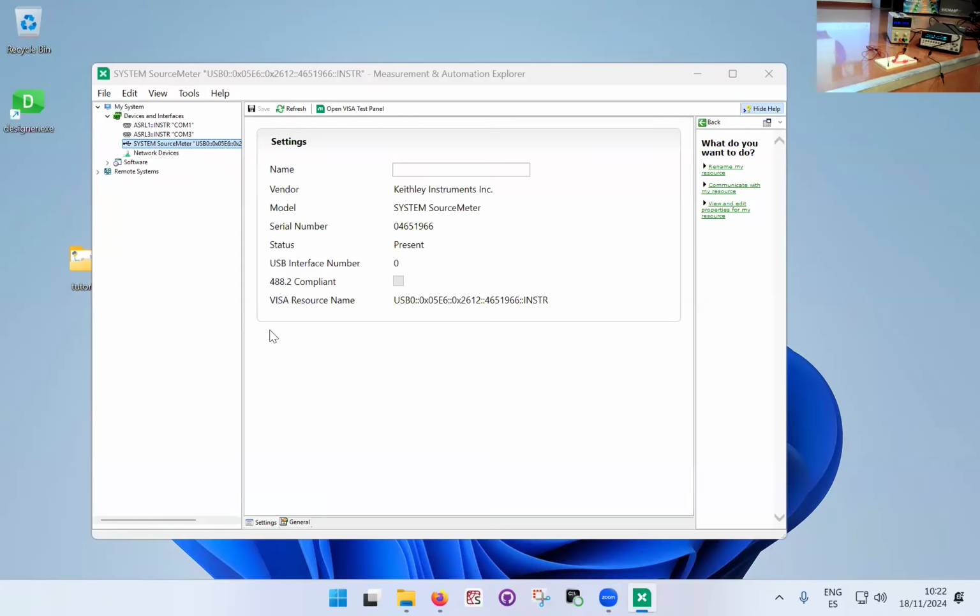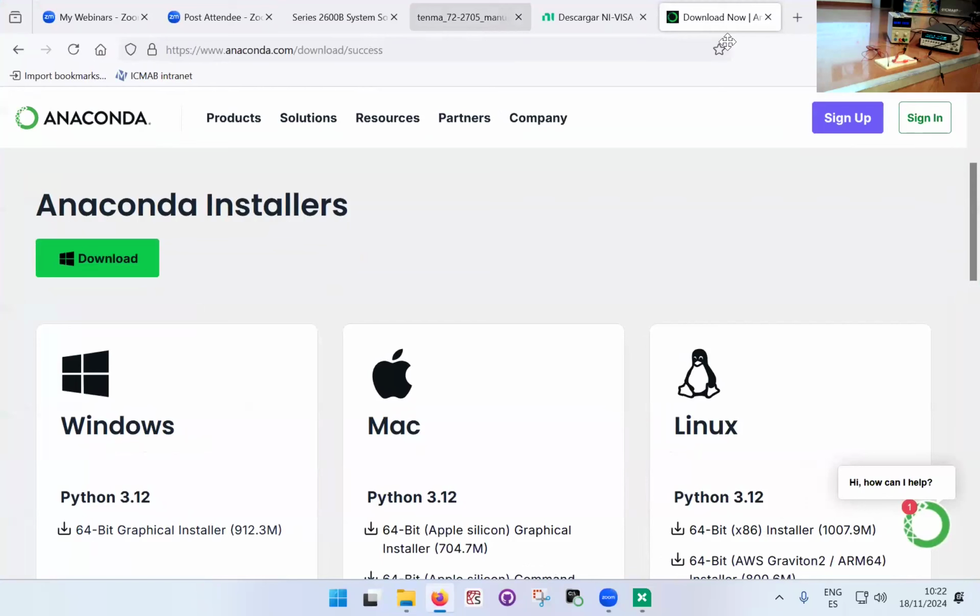So what commands are you going to send? Here you have to open the manual of your instrument and see what commands it will actually recognize. So generally you will go here.